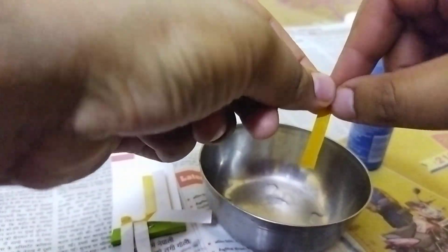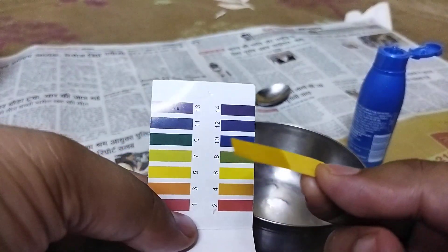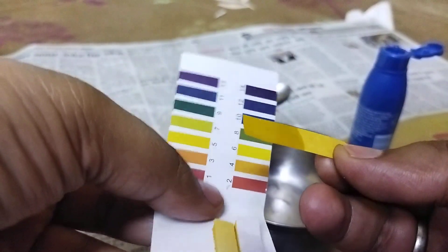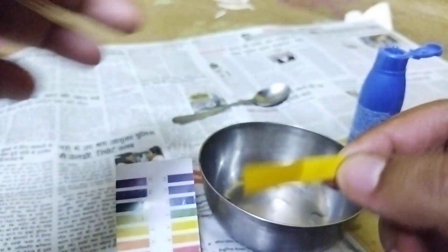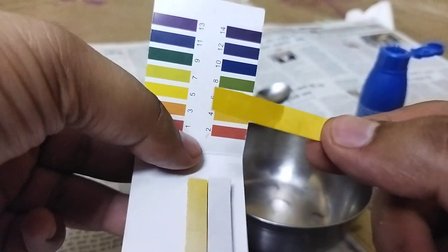That's completely fine, so let's look at the pH paper. Let's wait for it to get dry, like five seconds, so that we can have better results. Till then you can have a look at this awesome pH paper.